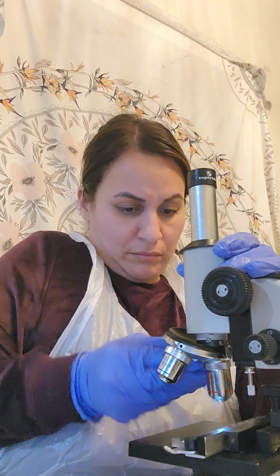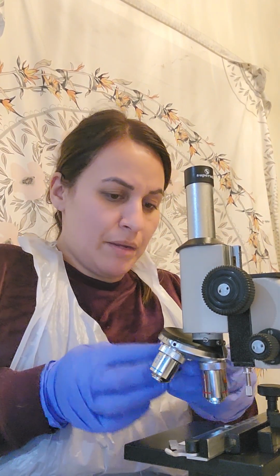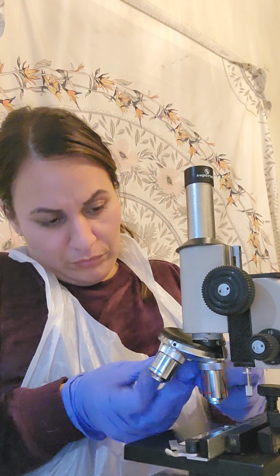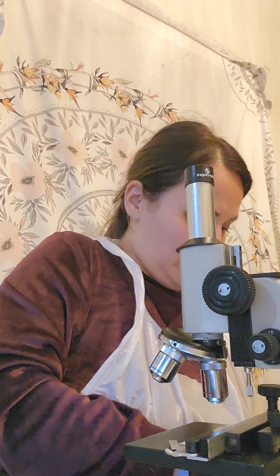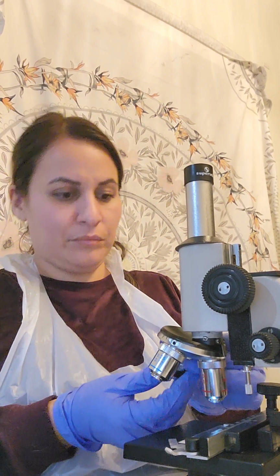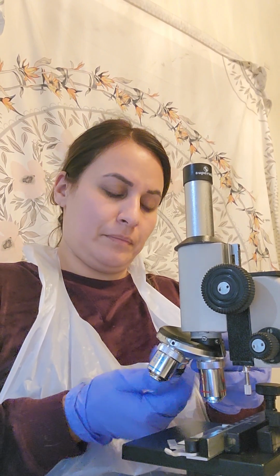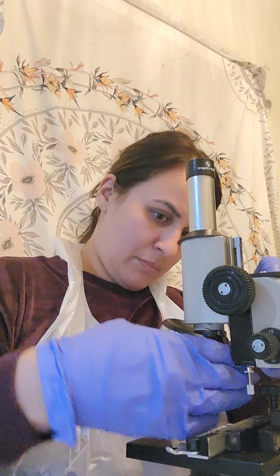So let me see here. All right, oil immersion time. Oil.